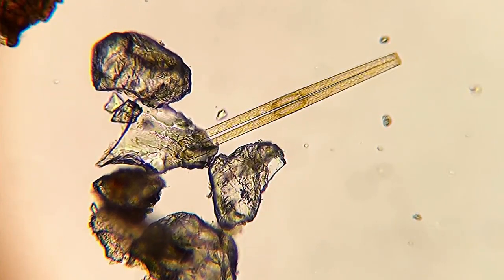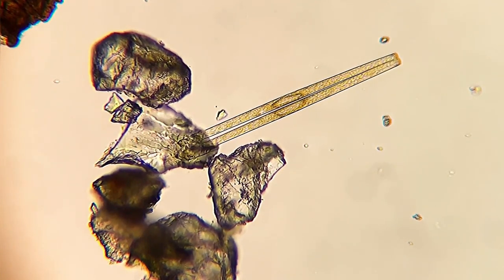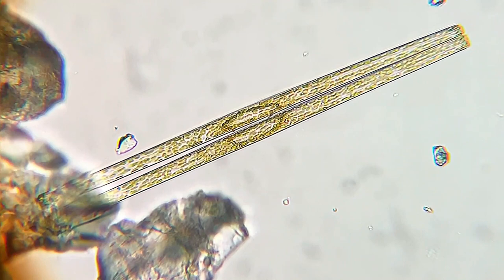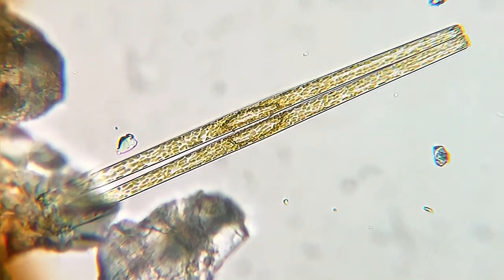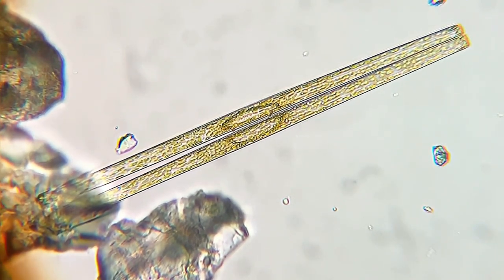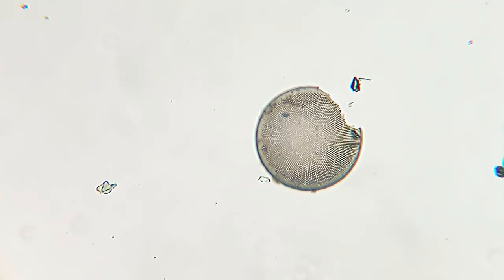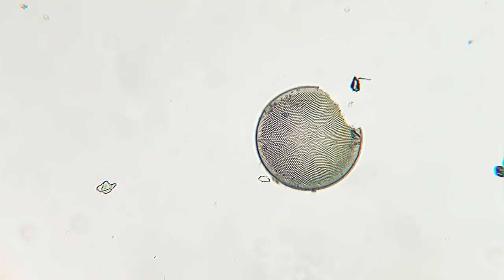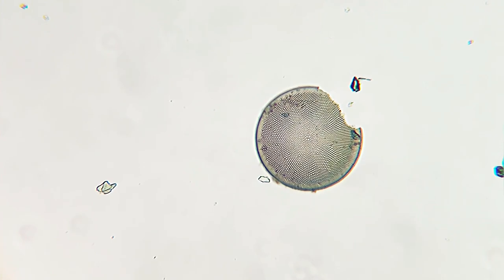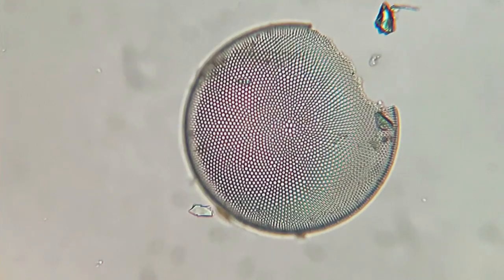Those are grains of sand, and that organism next to the grains of sand is a diatom. Diatoms are a type of microscopic algae. This amazing structure that you see is part of another species of diatom.